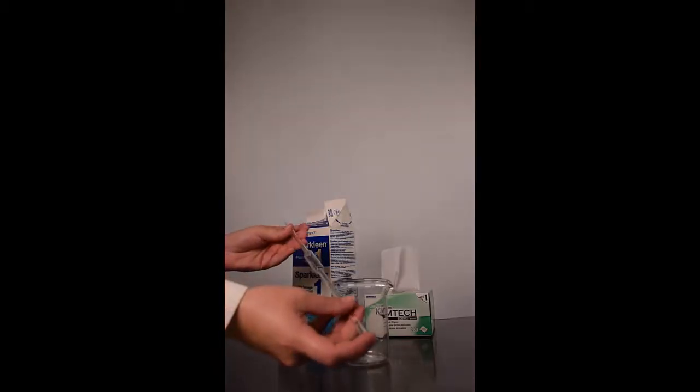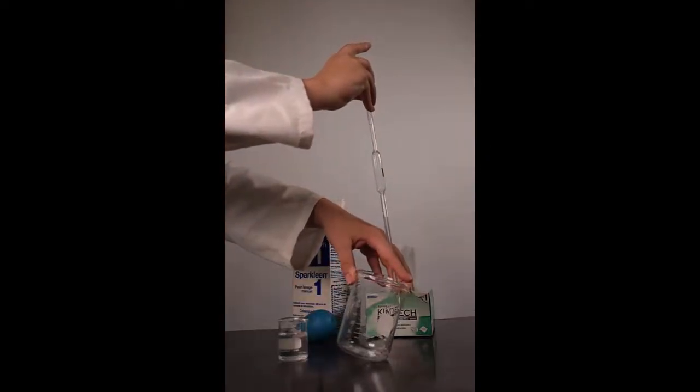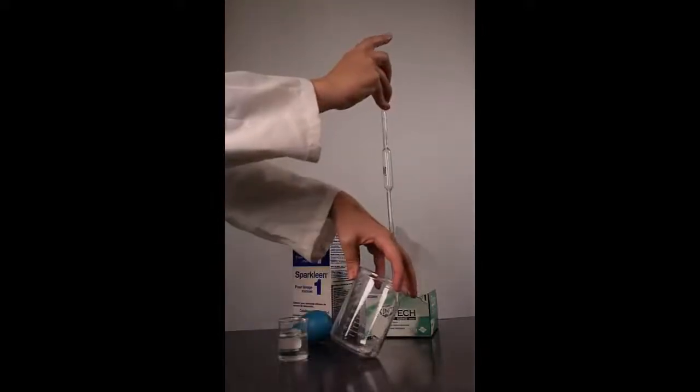It is important to rinse above the calibration mark because solution will rise above this level before the volume is adjusted. Repeat rinsing the pipette two more times for a total of three rinses.